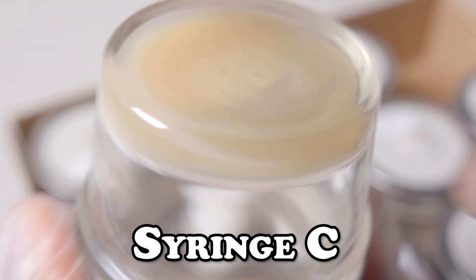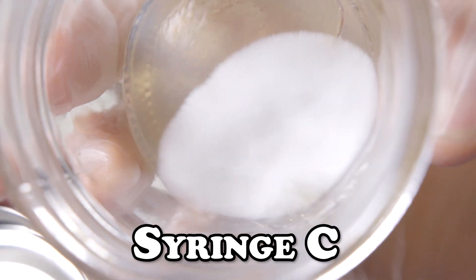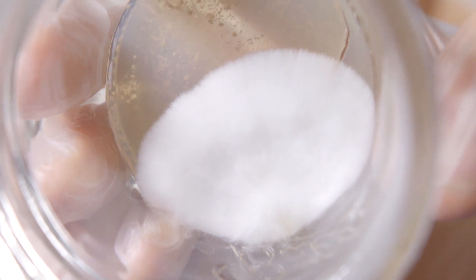Now it's time to have a look at our syringe set C. This plate is looking pretty good to me. We can isolate it maybe another round or two, but for now we'll go ahead and put it in a slant.